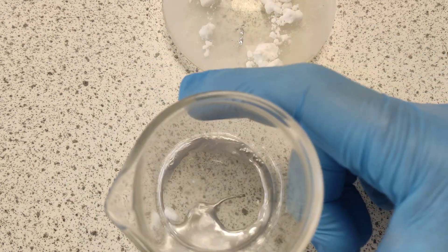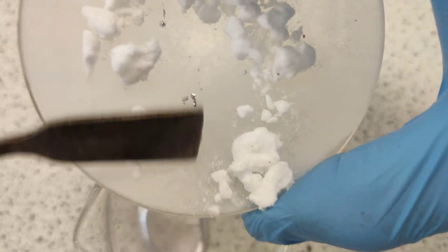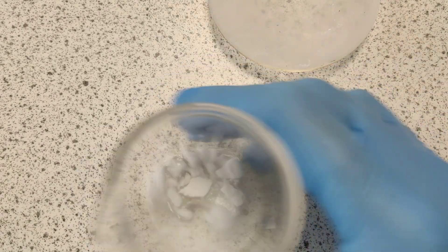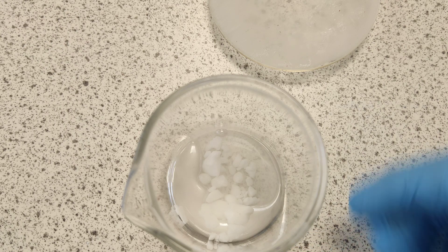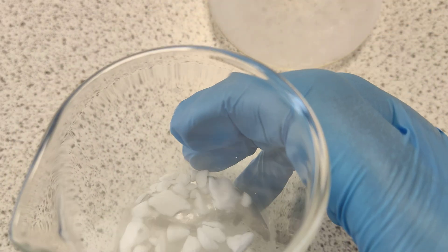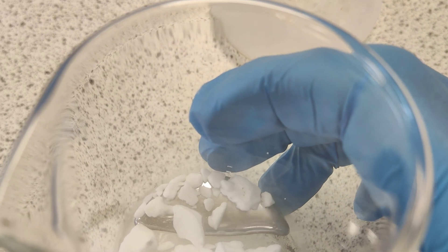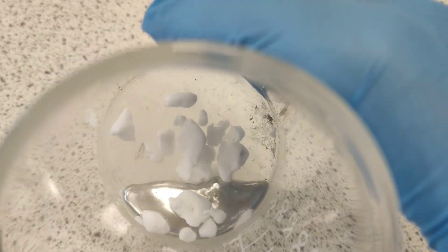And then, quite interestingly, look at what's happening with my dry ice. Let's get that last bit of mercury off here because it's actually solid and we don't want it to stay on the watch glass. If we use our nice little bits of dry ice in my beaker, you can see what's happening, can't you? How cool is that? A little bit of material science — we've got dry ice there floating on top of liquid mercury. You can hear it there evaporating as it sits on top. Who would think that was a metal?